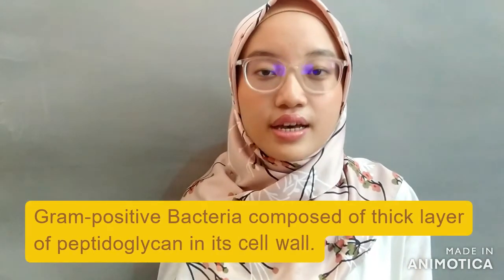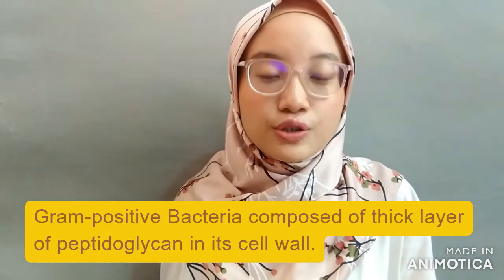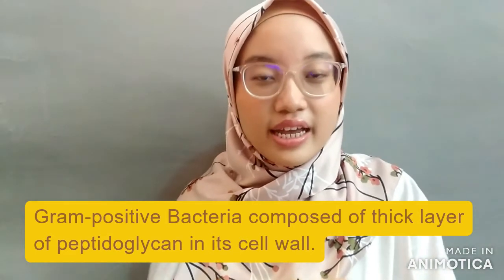The purple-violet stain indicates gram-positive bacteria, while the reddish or pinkish stain indicates gram-negative bacteria. This happens because gram-positive bacteria have a thick layer of peptidoglycan, so they have the ability to retain the purplish or violet color of the crystal violet that we use as the primary stain. Now I'm going to show you how it is done.